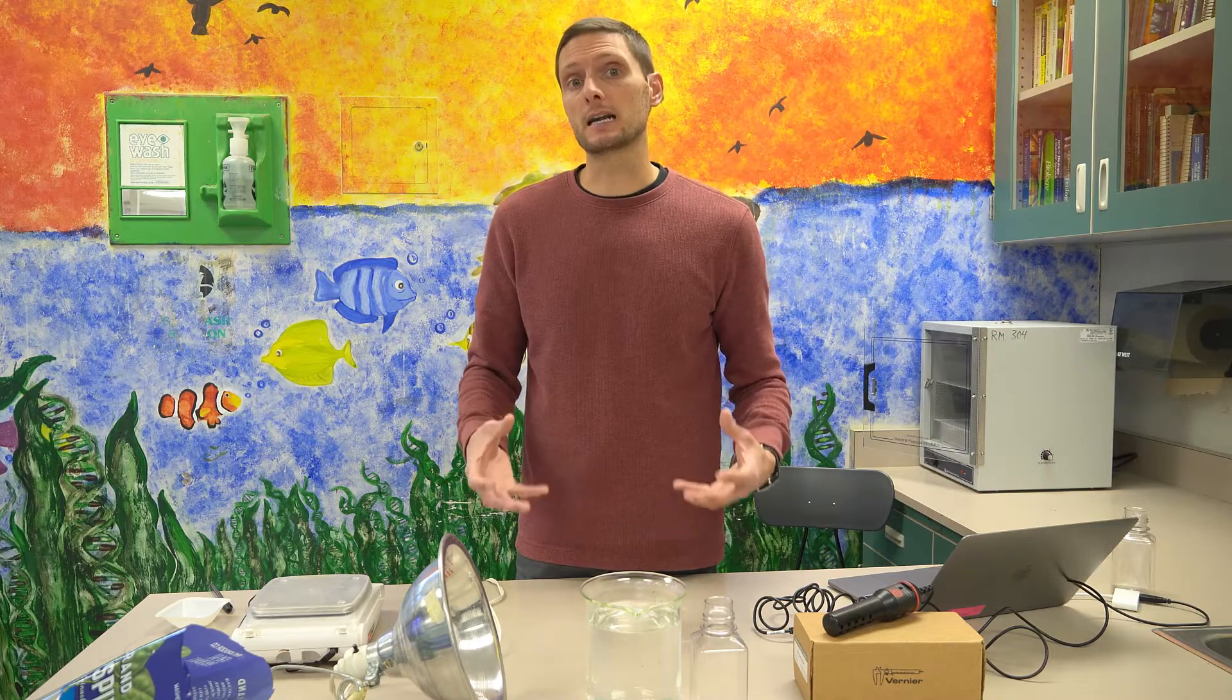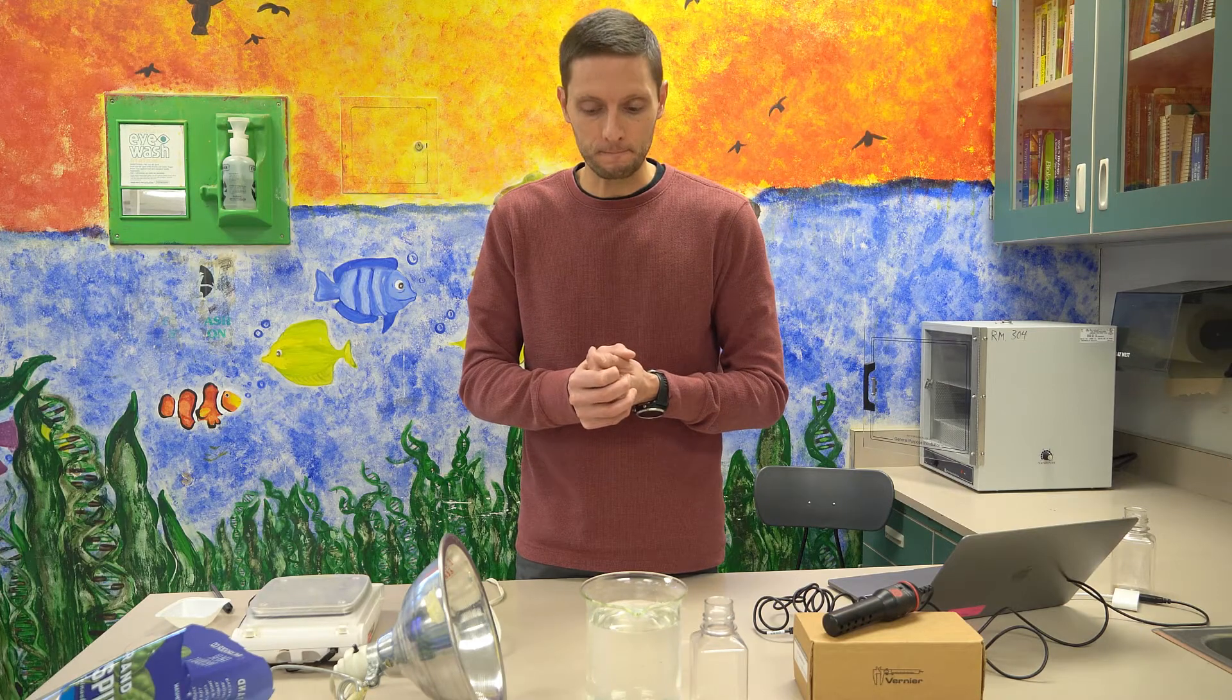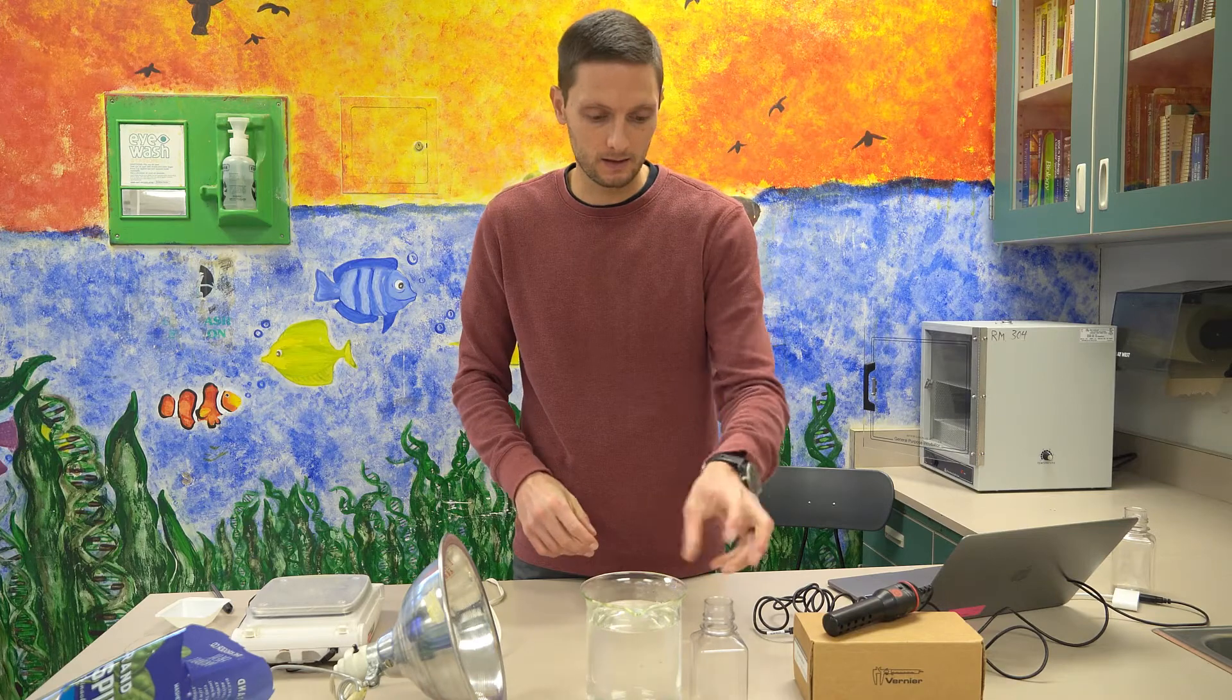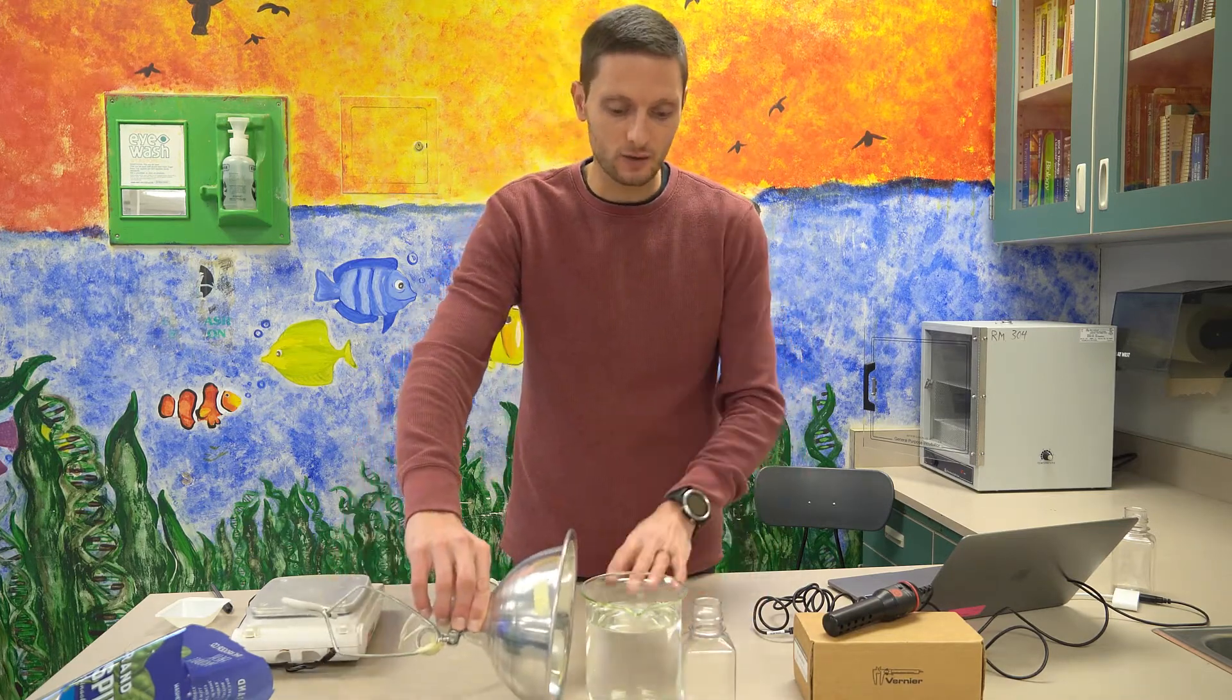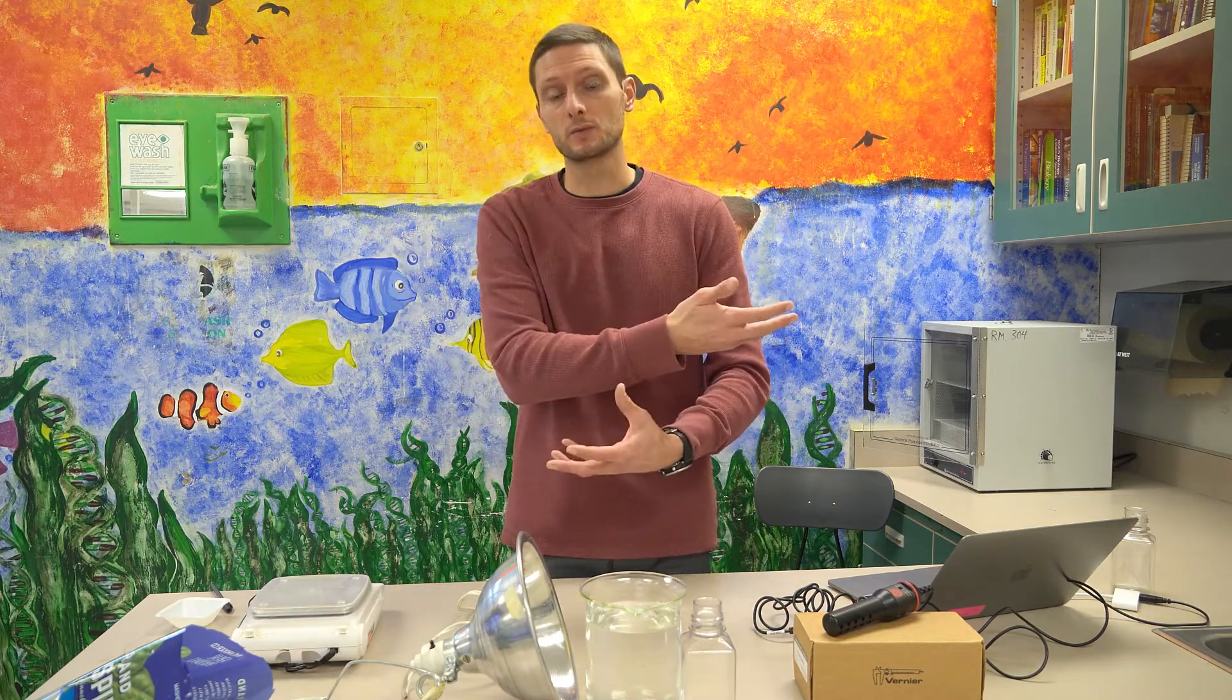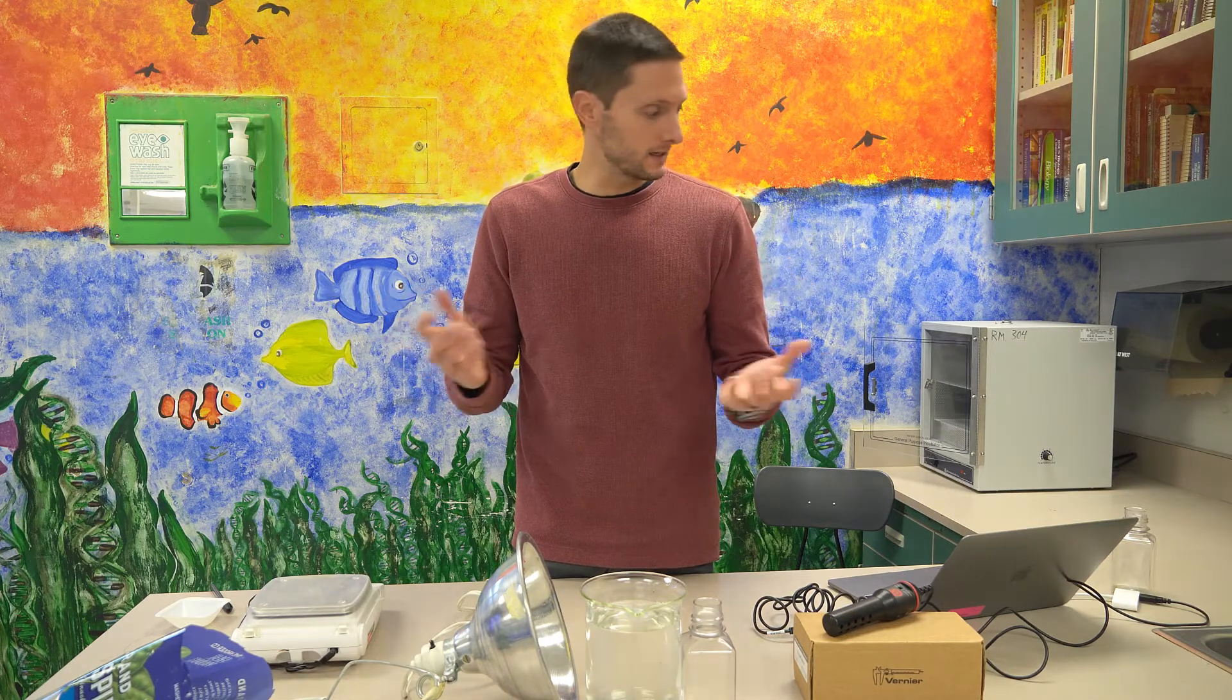So we want to make sure that we're not causing that heat to influence our overall results. And so what we'll do today is set up our apparatus here, our vials, so that the light actually shines through the water here. And what the water will do is absorb that heat, but it allows the light to pass through still. So it really works well to help us control the variables in this condition. And so we'll go ahead and get started here.